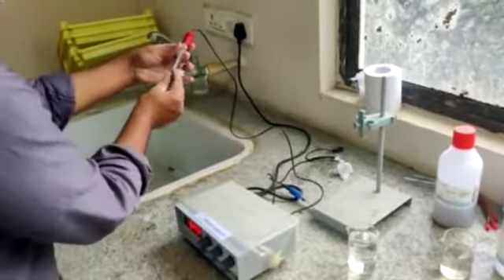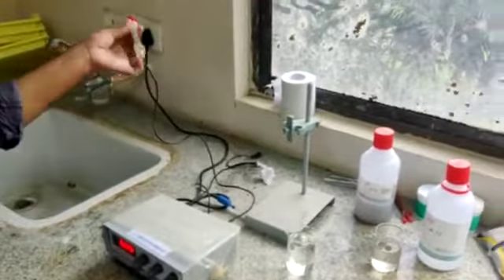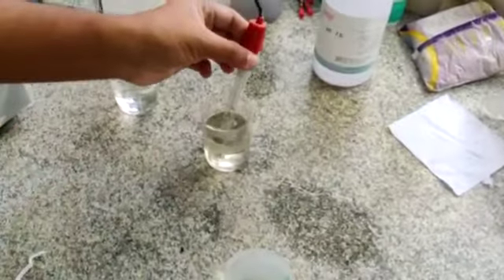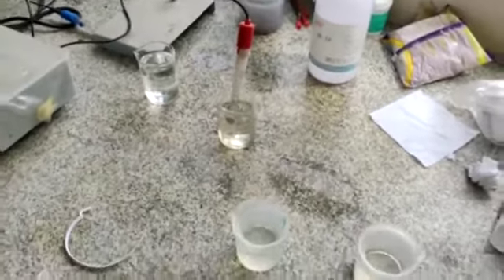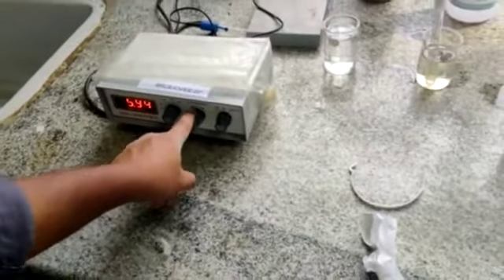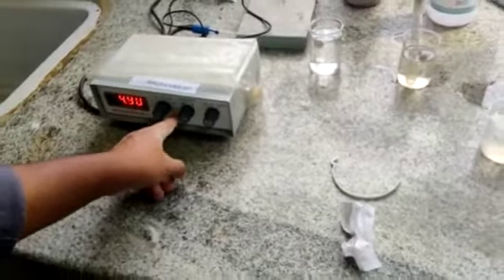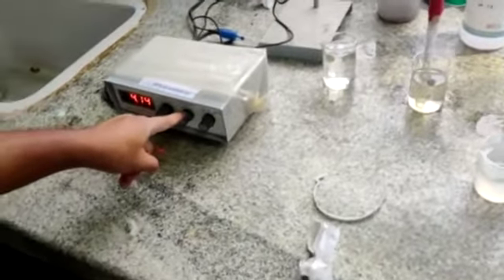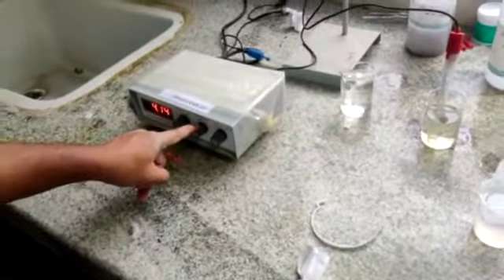Then dip to another solution. It is acidic solution. When you dip it here, you have to adjust using this standardizing thing. So you have to make it to 4. When you dip it to 4, now you have to experiment this one.